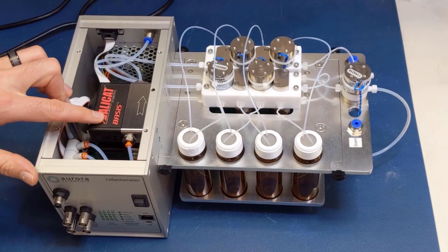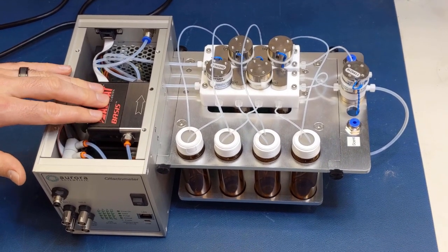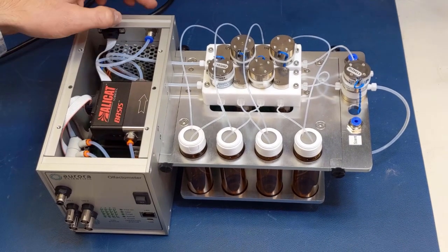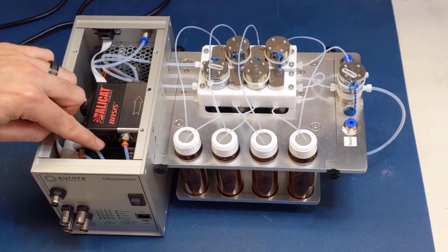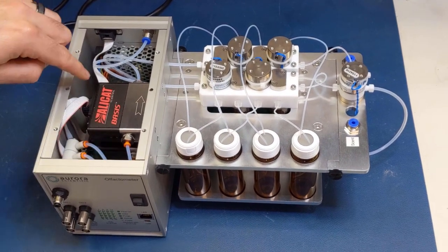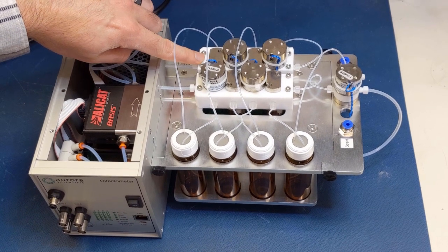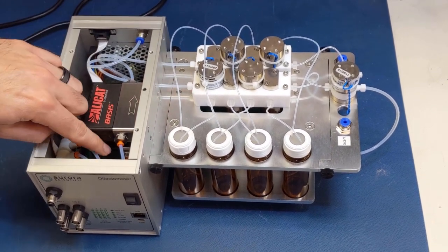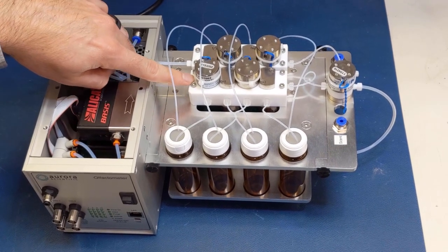There are three mass flow controllers in the control box. The first is a 1000 SCCM unit at the top, which is the exhaust line — this is clean air flow that exits the back and is matched to the scent flow to minimize pressure changes. The second 1000 SCCM MFC is located underneath and represents the dilution flow through the valve manifold that mixes with the odor stream. Lastly is the 100 SCCM MFC at the bottom that flows into a specified vial and generates odorant.